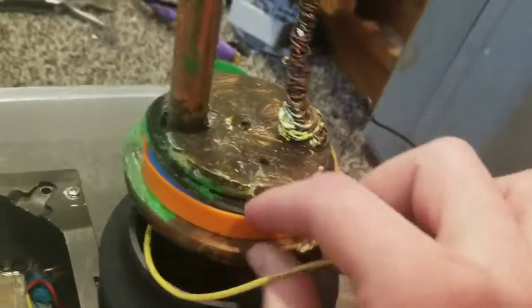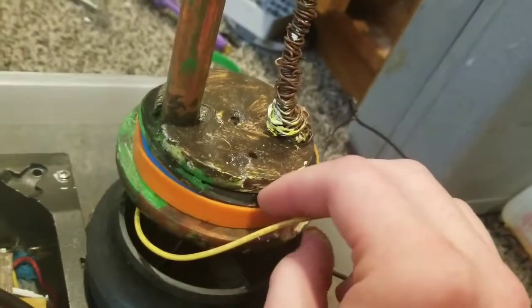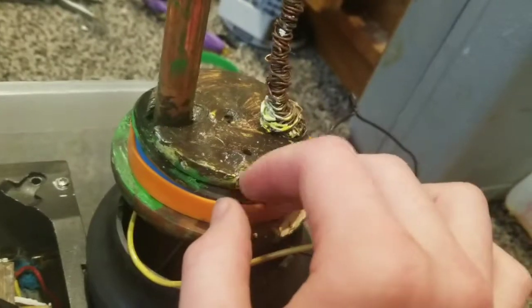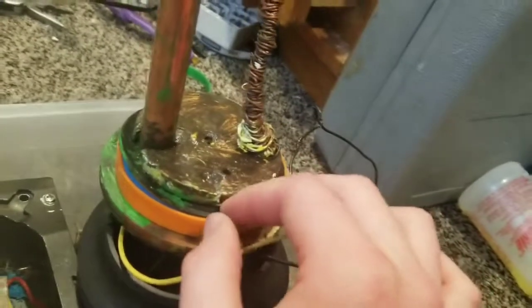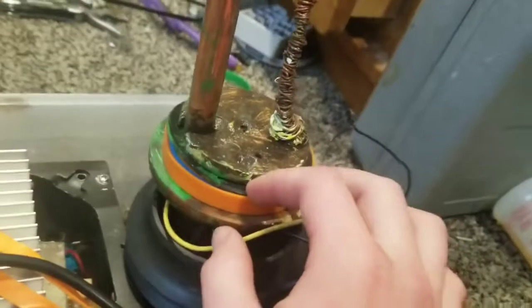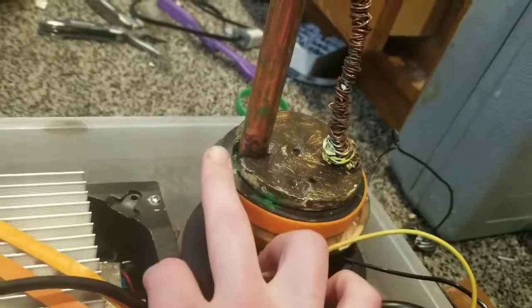So it's important that you get a nice seal. I used a lot of rubber bands and stuff down here. It is very important you get a nice seal, because nitrogen oxides are pretty toxic, and it's also important to run this outside, since there will be some escape of nitrogen monoxide if you are bubbling it through water, or even hydrogen peroxide. That process is not 100% efficient in destroying the nitrogen oxides, converting them into nitric acid. But anyway, yeah, it is important that you run this sort of thing outside. Just going to throw that out there.